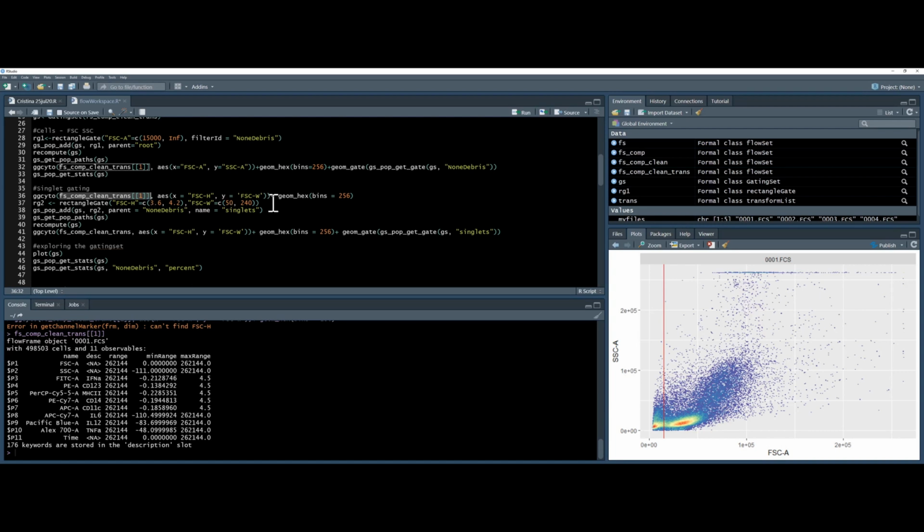But if I were to do this, I do exactly the same again. I make a second rectangle gate with the coordinates. The coordinates here are wrapped in c, and this c means that I'm grouping multiple values together. So if I'm creating a box, I need to have the X and Y coordinates. So that's what I have here. I use the gating set population add command, and I apply it. The parent this time is not root, it's non-debris. I give it the name singlets, and then I can recompute it.